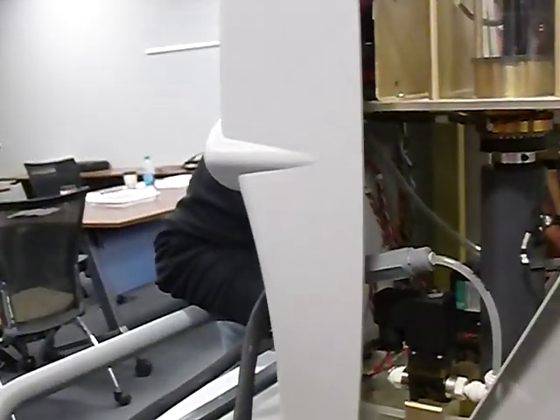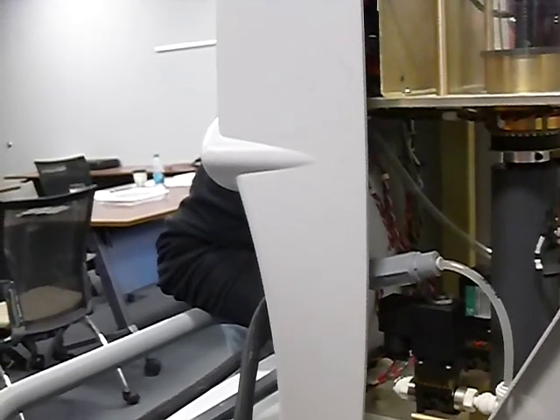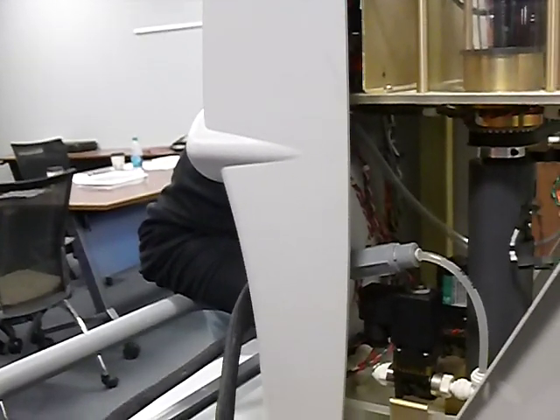And that loop is to help it for degassing. Is it permeable to the gases? Is the steel permeable or not? It's polypropylene, so, yeah. So just Tygon. Okay?